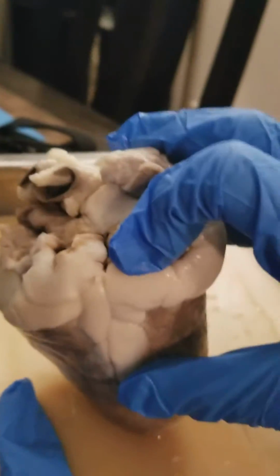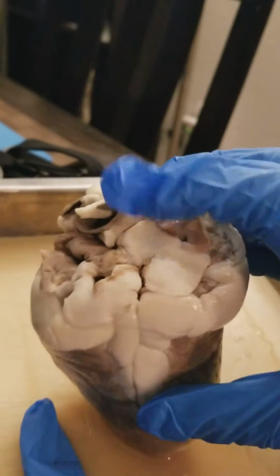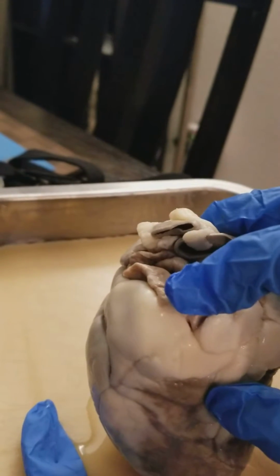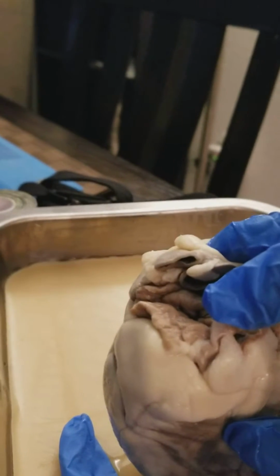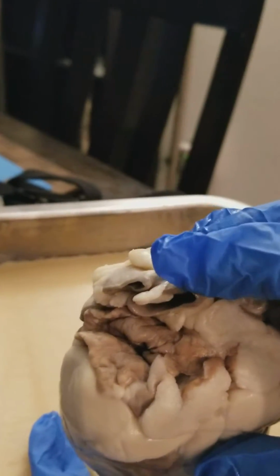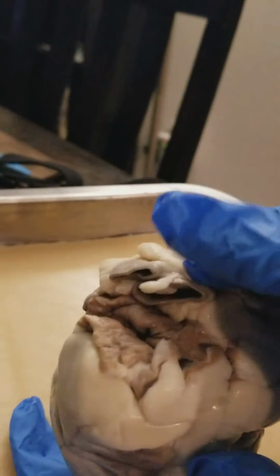So the tricuspid valve prevents the backflow of blood into the right atrium. And the tricuspid valve is inside, which I'll cut open shortly, would be around this area, right above the right ventricle. And then from there you have the right atrium, which receives deoxygenated blood from the body through the vena cava and pumps it to the right ventricle. So the right atrium is actually up in this area, and once I open it or cut it, I can show it a bit better, but it'll just be an opening.